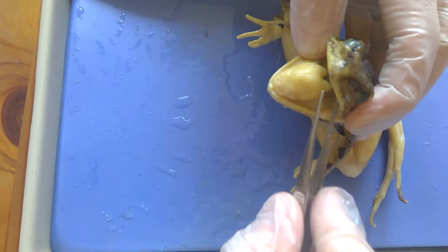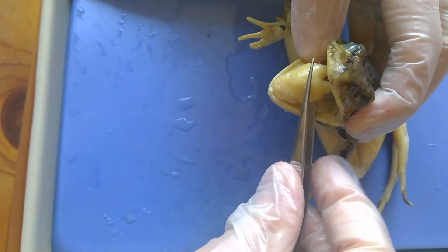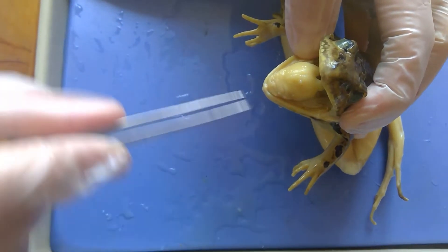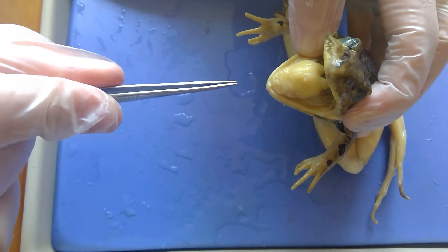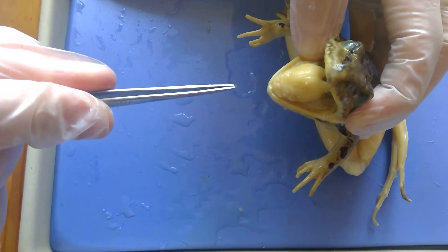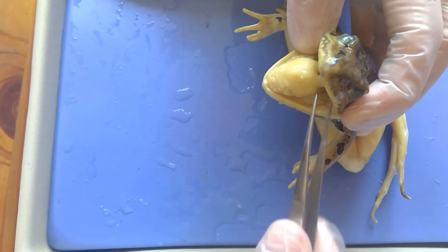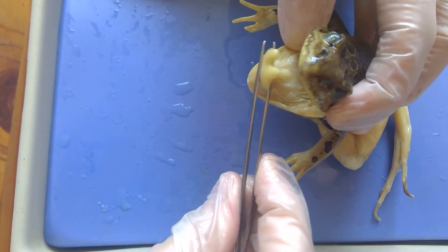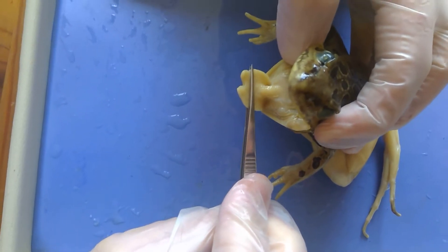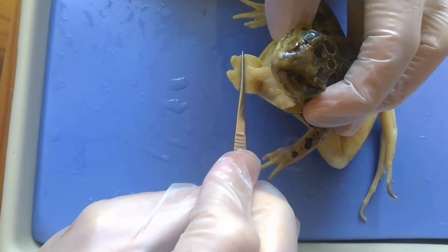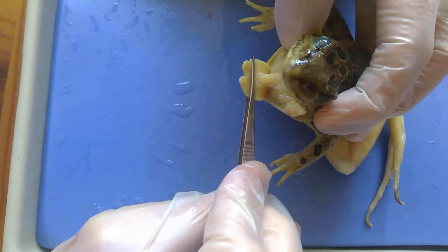The frog instead uses its tongue more like a mousetrap, where if the food item is here, it waits really patiently for something that it can eat to get up near it. And then its tongue will reach out like this, slam down onto it, and then pull back.